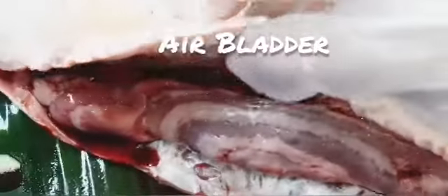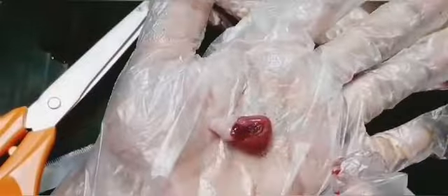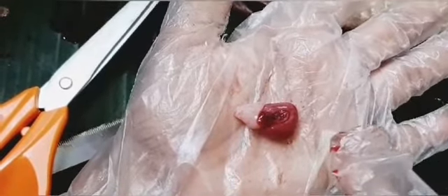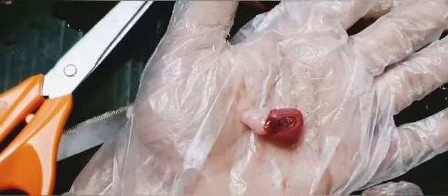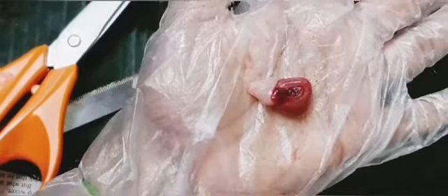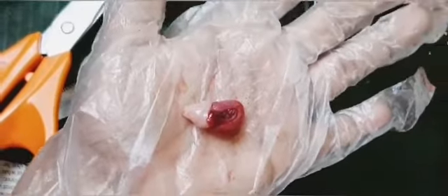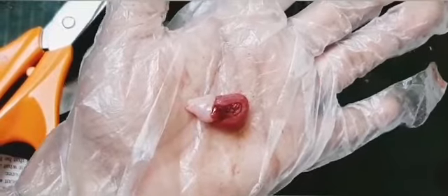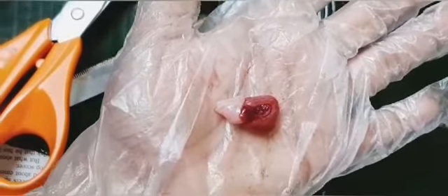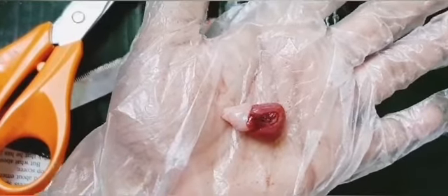Now at first I want to show you the heart. This is the heart of the fishes, and this heart generally has two chambers. There is one auricle and one ventricle, and with the help of this heart and the gills, the fish can respire. Generally in fish there is a single circulation, that is, the blood goes only one time from the heart in one cycle.